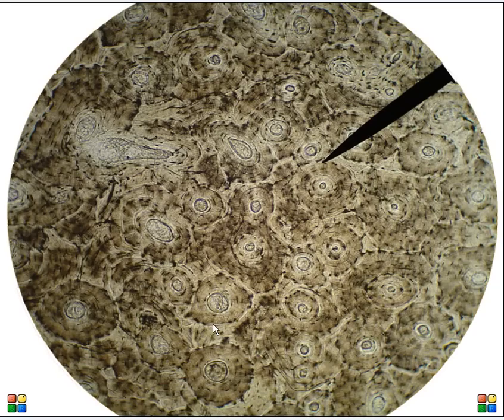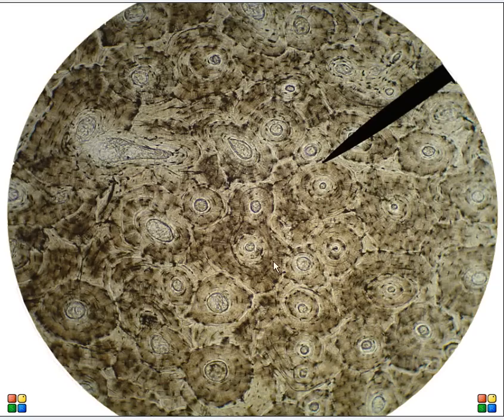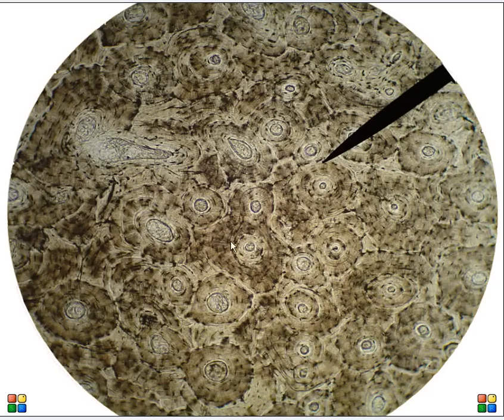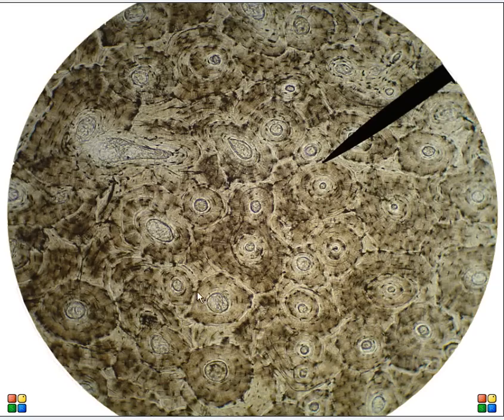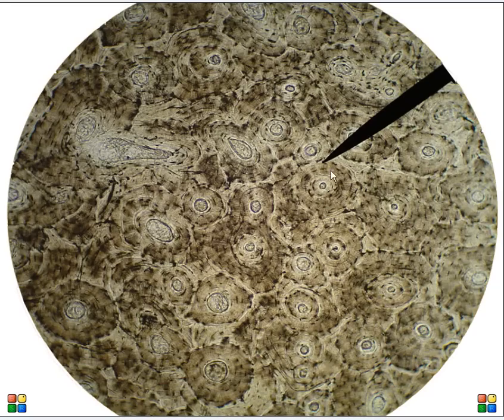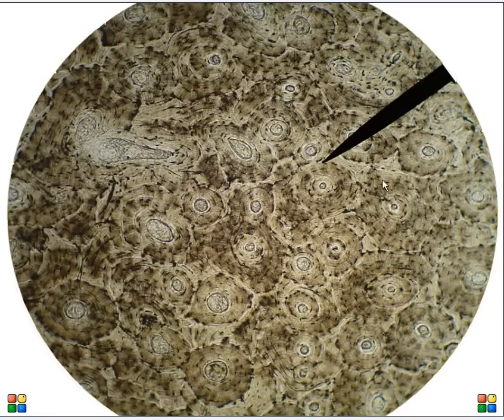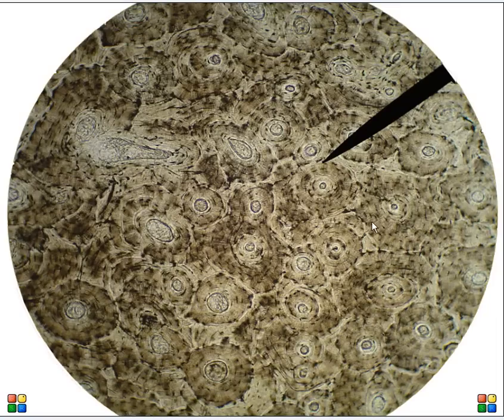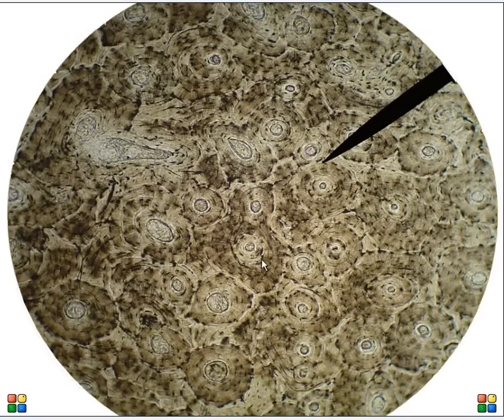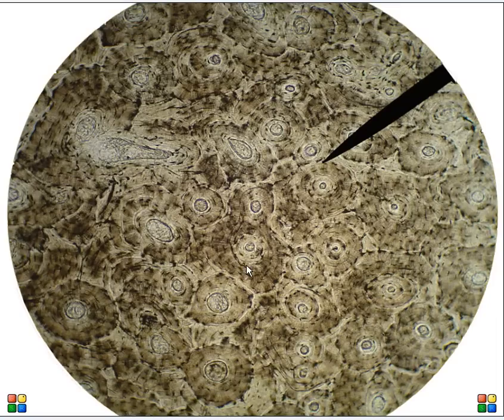Let's go to a higher magnification. Again, this is an osteon, this is an osteon, this is an osteon, and this is an osteon. This is also called the Haversian system, by the way.